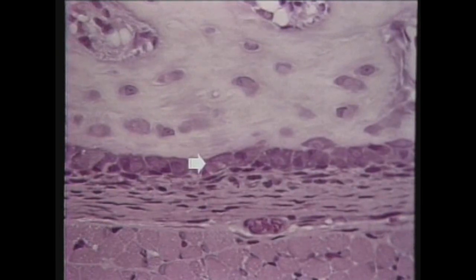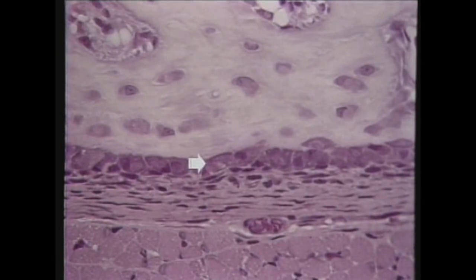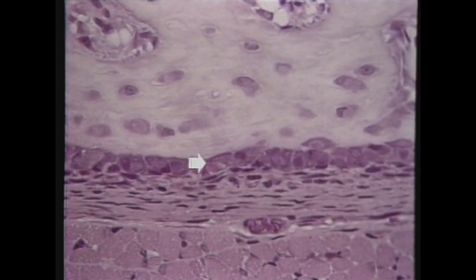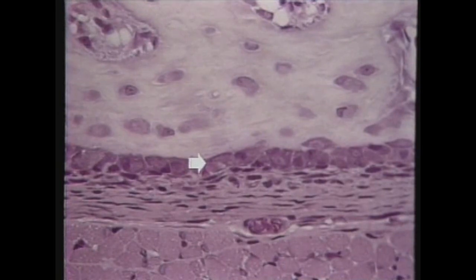Question number eight. What kind of cell is the arrow pointing to here? The arrow is pointing to an osteoblast. The osteoblasts here line the inner margin of the periosteum and sit directly on top of newly formed bone matrix.